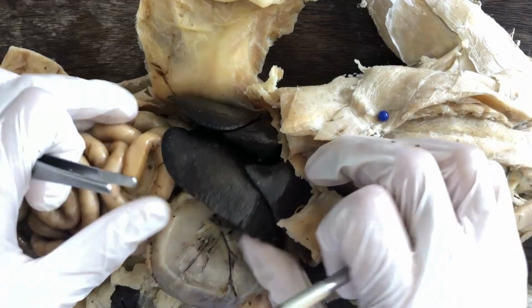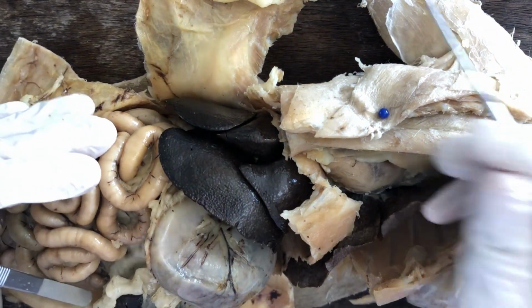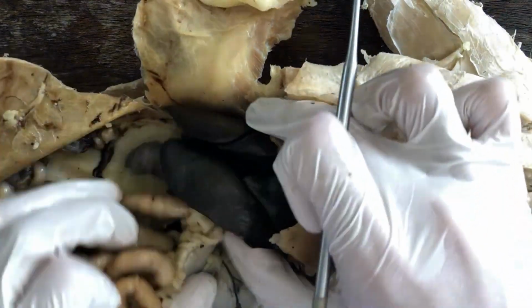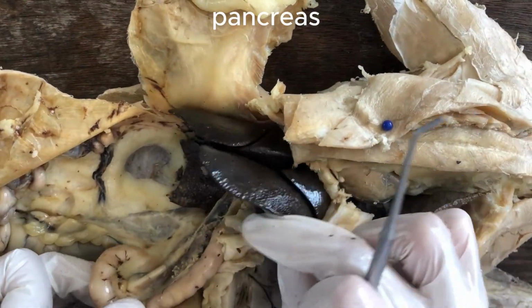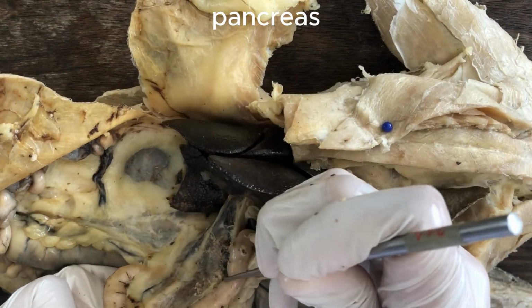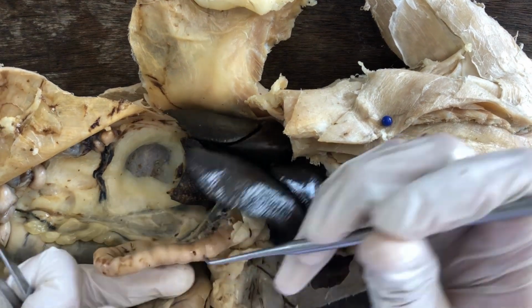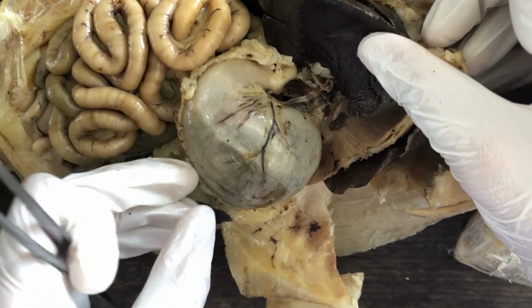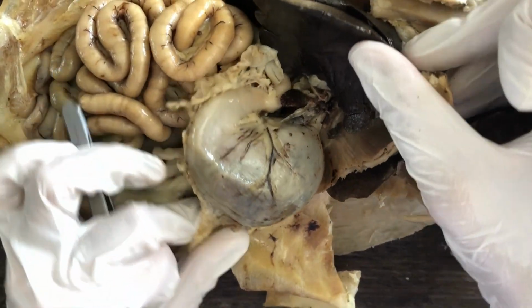And from the alimentary canal branch out accessory digestive organs, mainly the liver and the pancreas. That's the pancreas next to the small intestine. Let's examine them more closely. Okay. So the esophagus becomes the stomach. Okay. In this case, our cat, the stomach is distended.